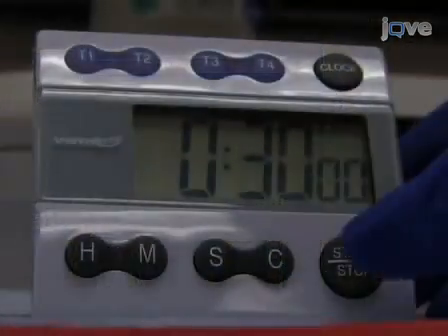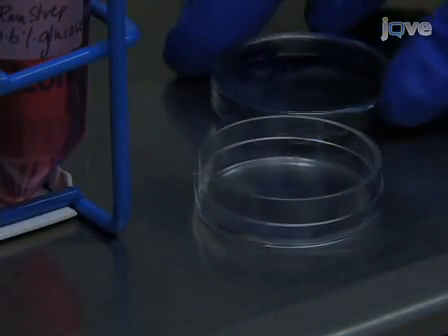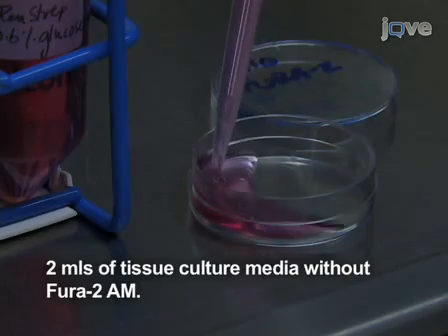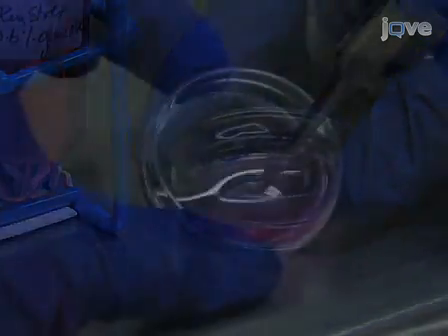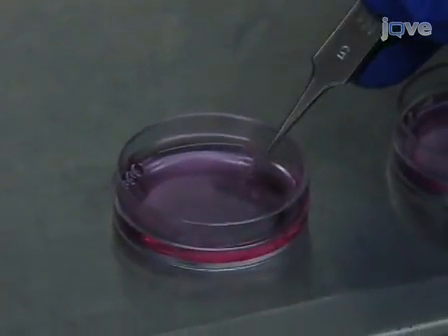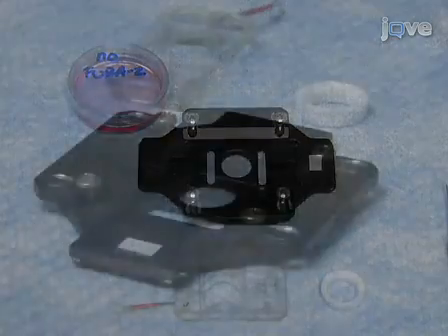Incubate the neurons at 37 degrees for 30 minutes in a dark incubator. Time the incubation precisely. During the incubation, prepare another 35 millimeter tissue culture dish containing 2 milliliters of tissue culture media without Fura-2-AM. When the incubation is complete, remove the coverslip from the loading solution and place it in the new dish. After immersing the coverslip in Fura-2-AM free media, mount it onto an imaging chamber.